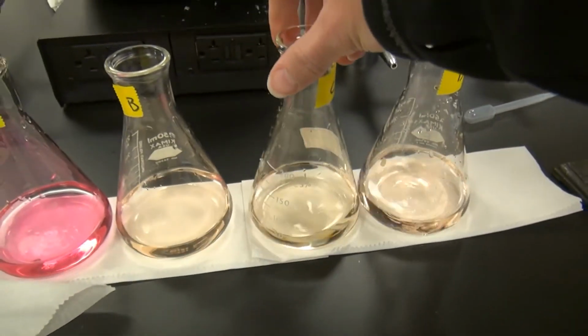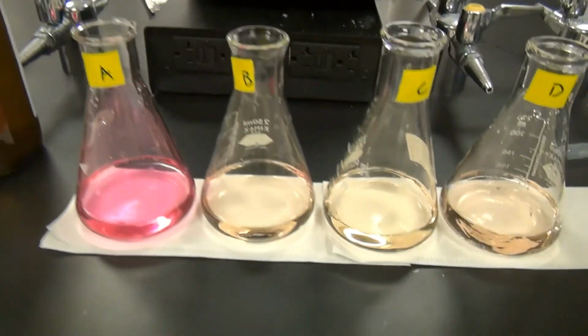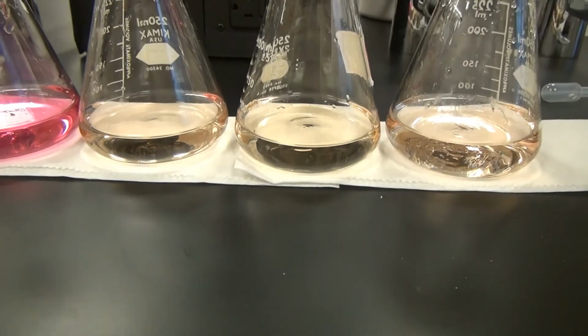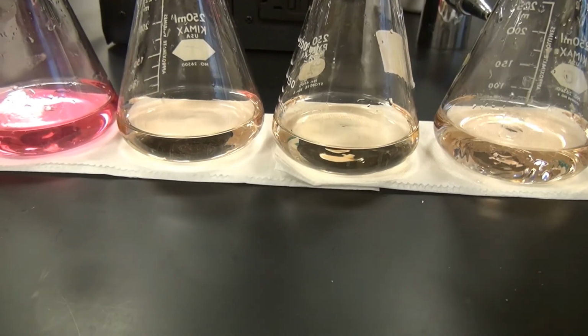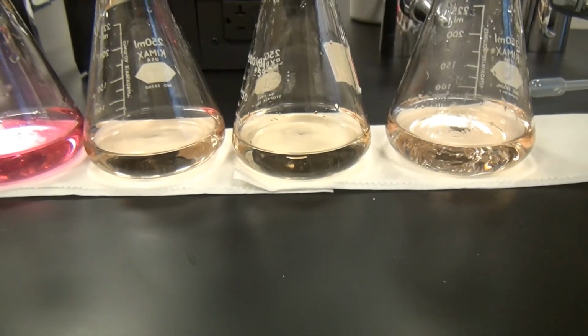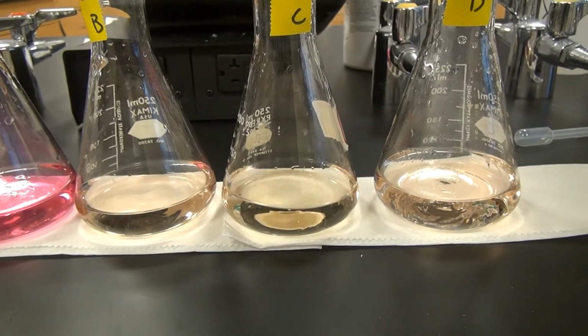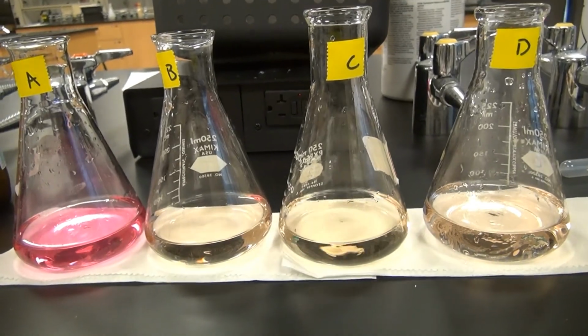All right, so take a look at all of our flasks here. And our Scout, our B, C, D, and see the slight color change in them. Okay. I think C was so accurate that the color just persisted shortly, and then eventually the pink faded away a little bit. But there we have it.